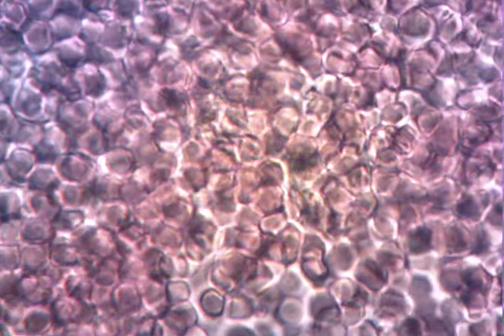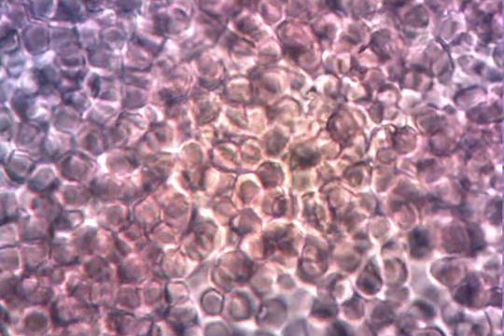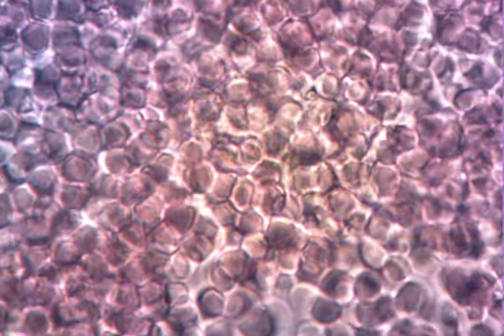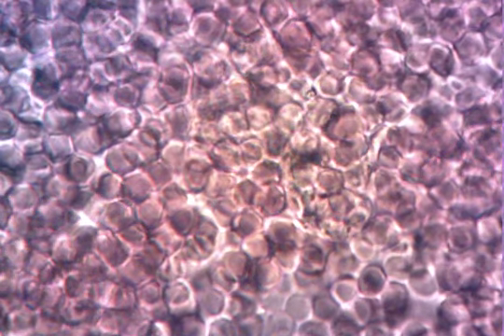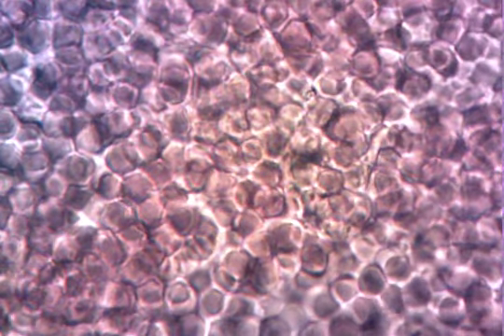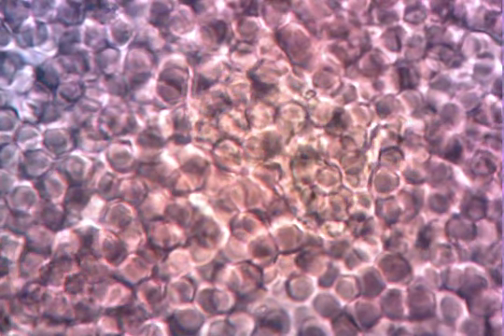You're getting osmosis going into the cell because the area of high concentration of water is outside, low concentration of water is inside. If you follow the solute, wherever there's more solute, that's where water wants to flow. There's more solute inside than there is outside because I put pure water on there, right? Pure water has a very low amount of solute, high amount of solvent, the water. So water always wants to flow where the solute exists.